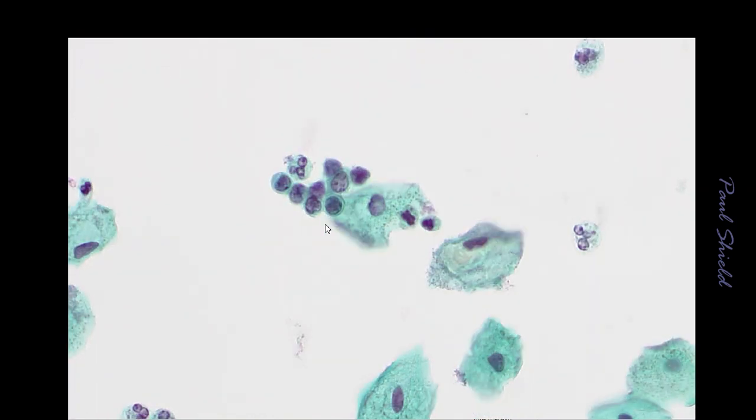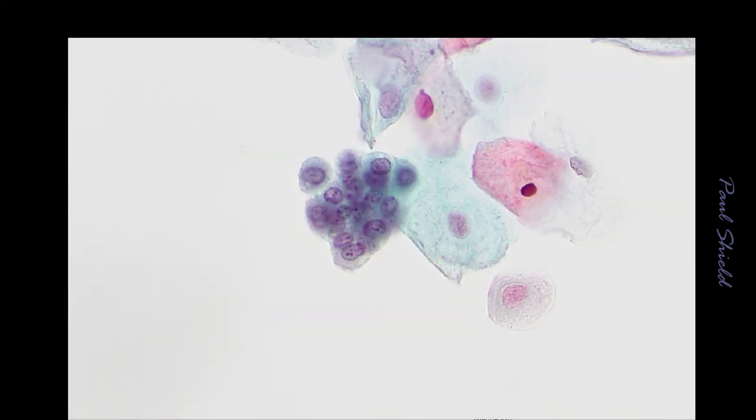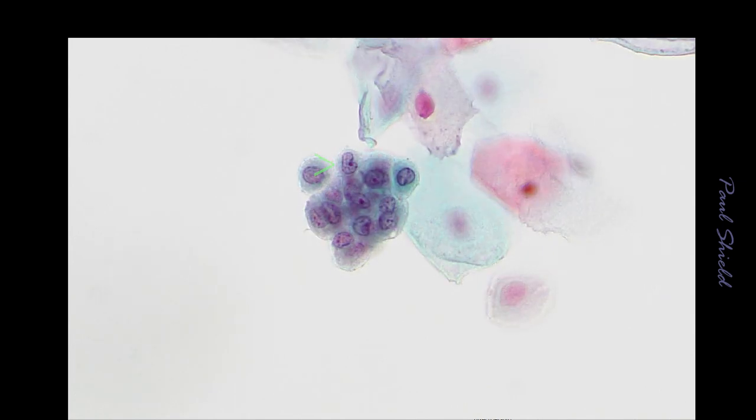Here's a little clump of actually quite small histiocytes. You see there's a neutrophil there, and they're around about the same size, a couple more down there. These are histiocytes. Another little clump of them here amongst some squamous cells. Again, they have sort of foamy cytoplasm. See that nucleus, which I'm bringing into focus, is probably renal shaped, kidney shaped or reniform.